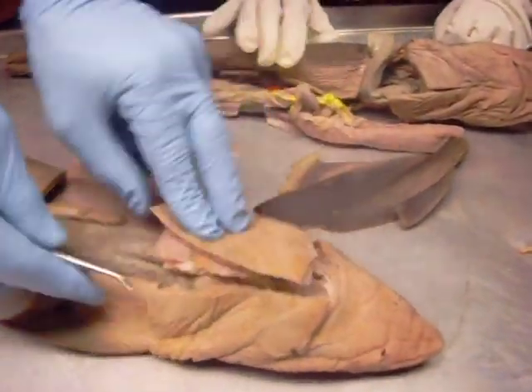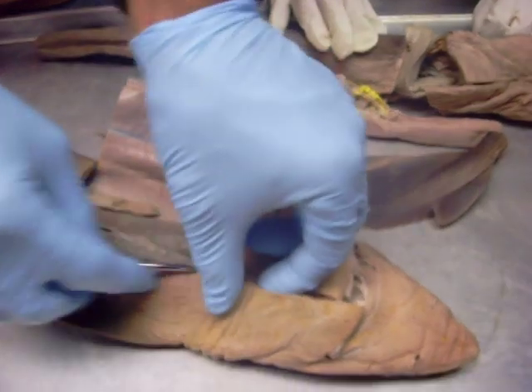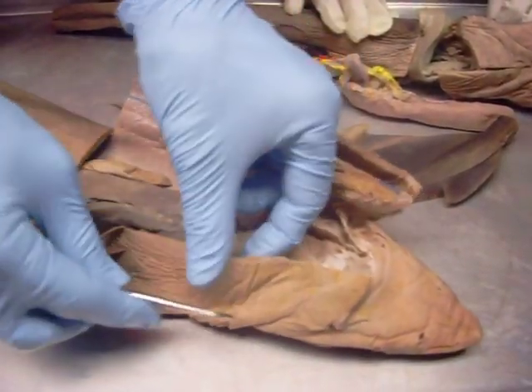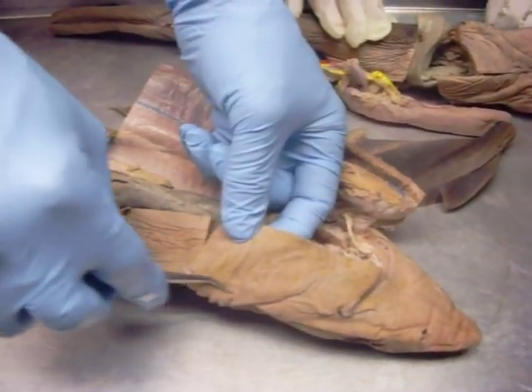These are gills in here, obviously. So these are the gills in there.